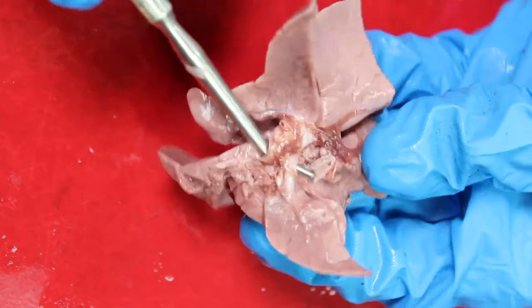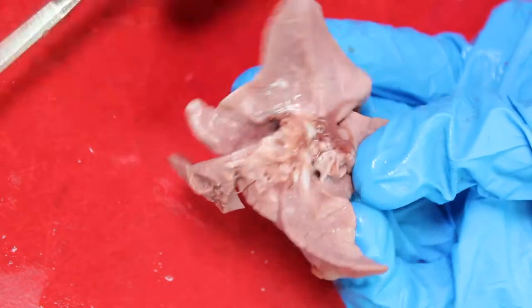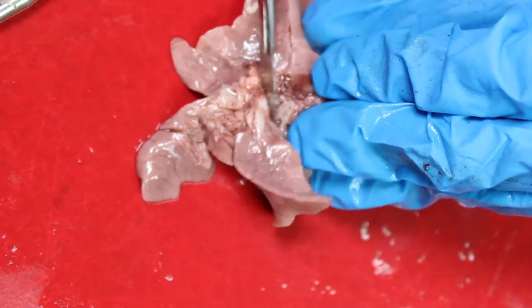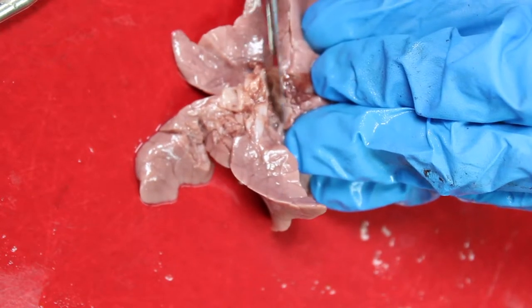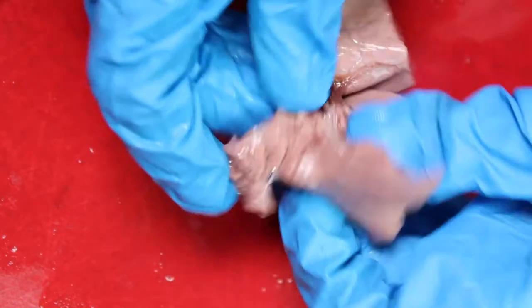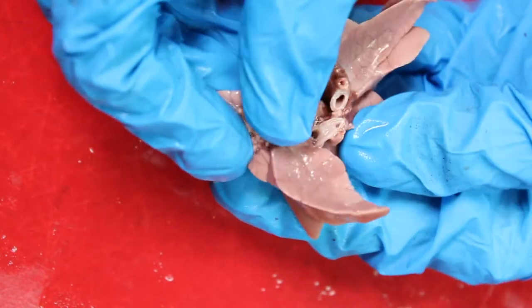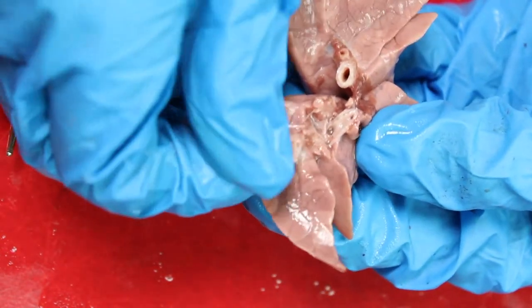Incomplete rings of cartilage in the trachea and smaller plates of cartilage in the bronchi keep these airways open. Bronchioles are too narrow to support cartilage and their walls are made of smooth muscle, and this is largely absent in the narrow respiratory bronchioles, which are mainly just of epithelium.